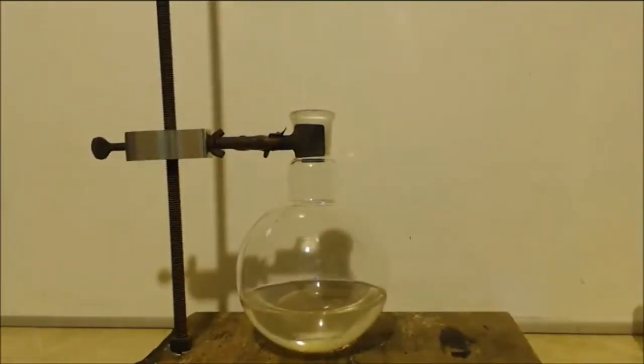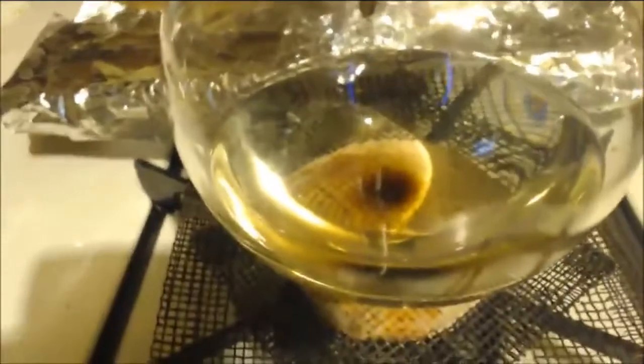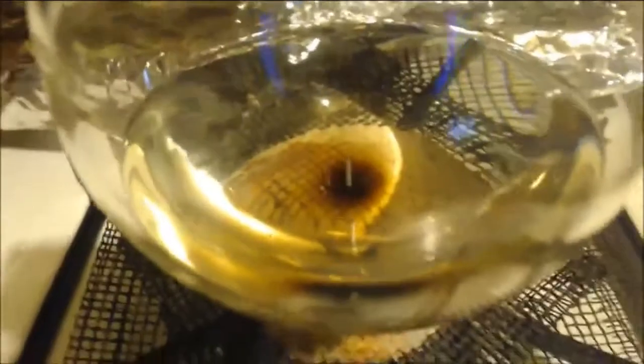And that's it. The sulfuric acid, I guess, acidifies and hydrolyzes some of the impurities and gets them out of there. Some of the side products. Well, it's only been like 2 minutes or something, maybe 3 minutes. You see that spot in the middle there? That's some kind of, maybe it's polymerizing it or something, I don't know, but it's getting rid of some of the impurities, I guess. Maybe I should have shook it around. Anyways, I just wanted to show you that it is getting rid of something.